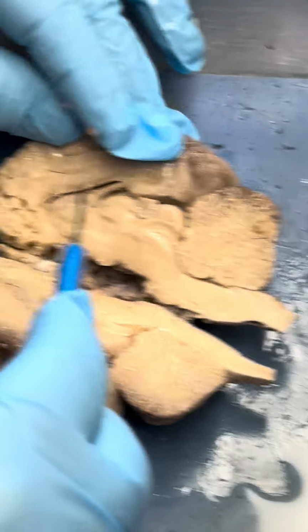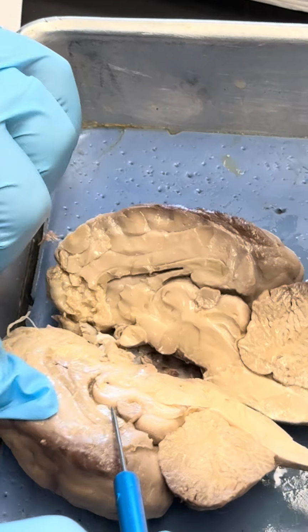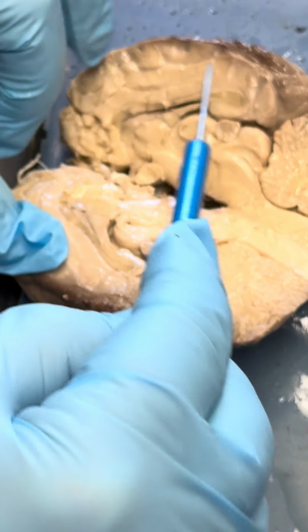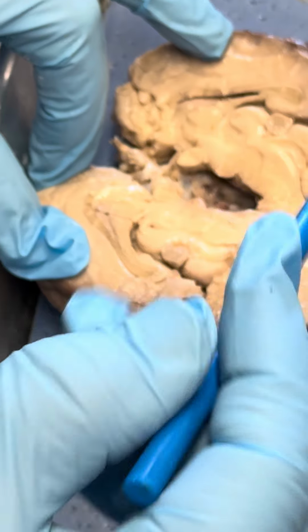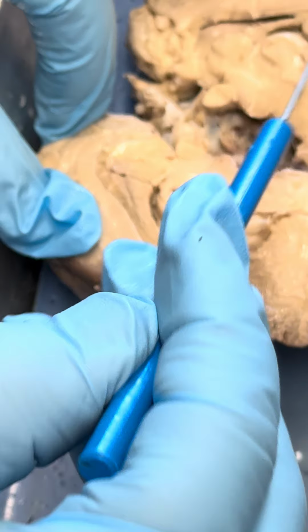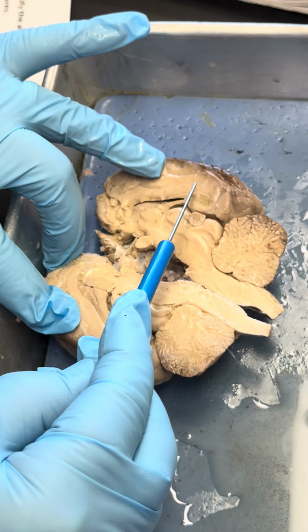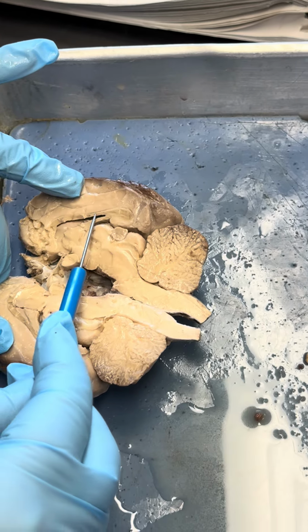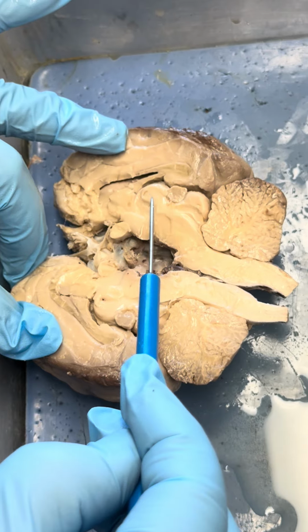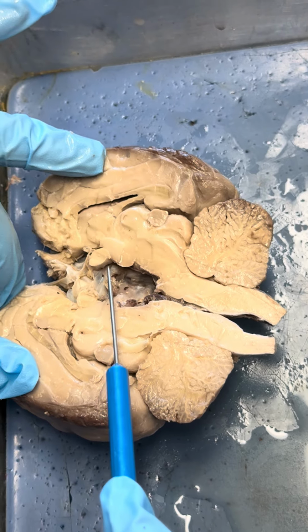And again here, lateral ventricle, and this is really nice because we would expect to see a hollow part here, so it's similar to that for where the lateral ventricle is. However, this here is now the septum pellucidum again. What we see there, that is the corpus callosum. So this here is kind of the corpus callosum. Here we have the fornix, and there, I'm not sure if I already mentioned that, that is the thalamus, hypothalamus.